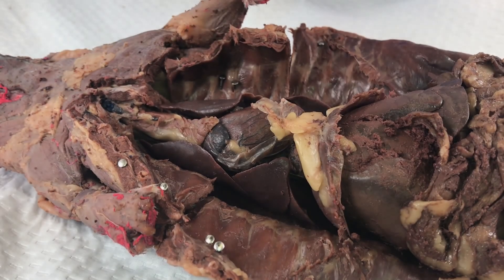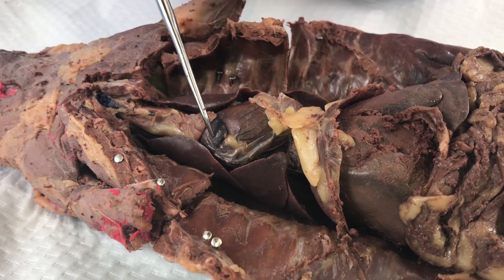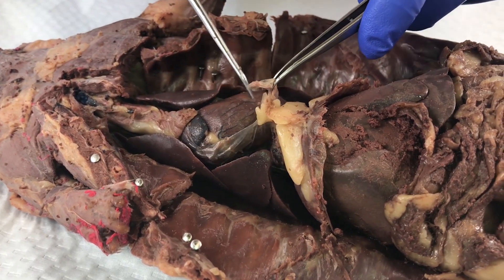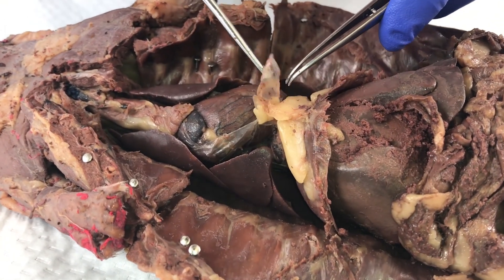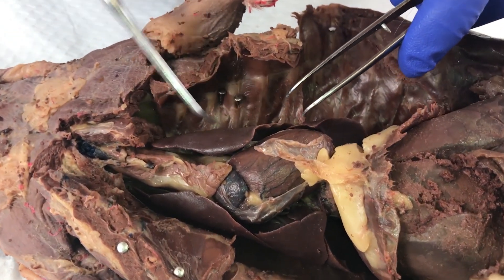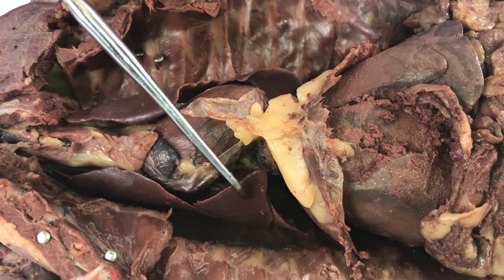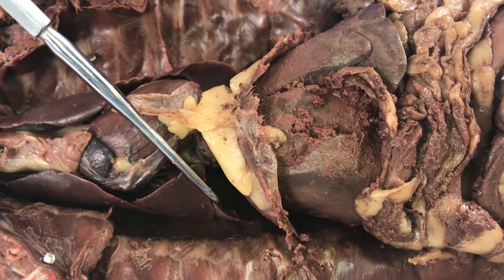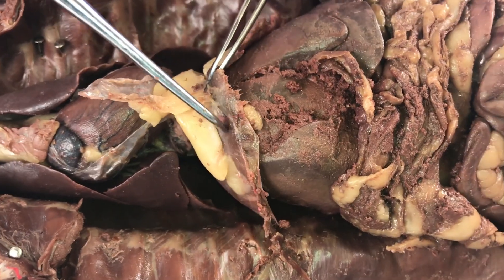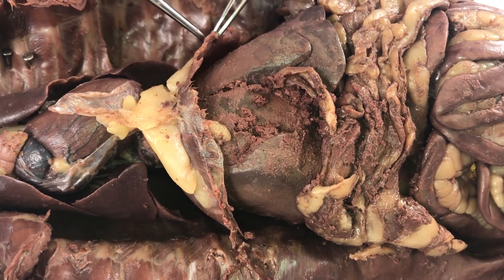Here we can see the thoracic cavity. We have an atrium and ventricles of the heart. You can see the pericardium, which was opened to reveal the structures of the heart. We have the lobes of the lungs that sit to either side of the heart. Beneath that is the diaphragm right here, which separates the thoracic from abdominal cavities.